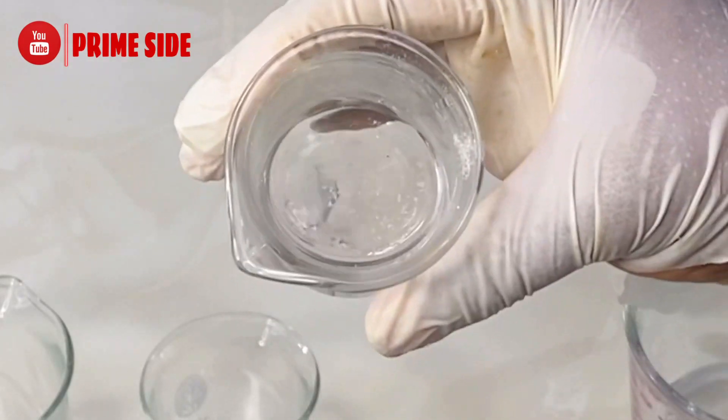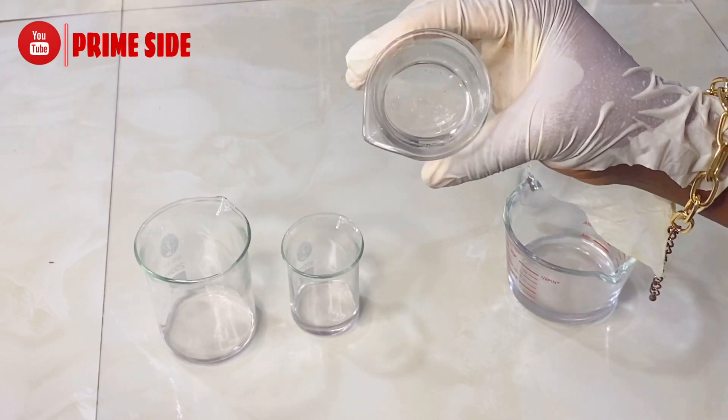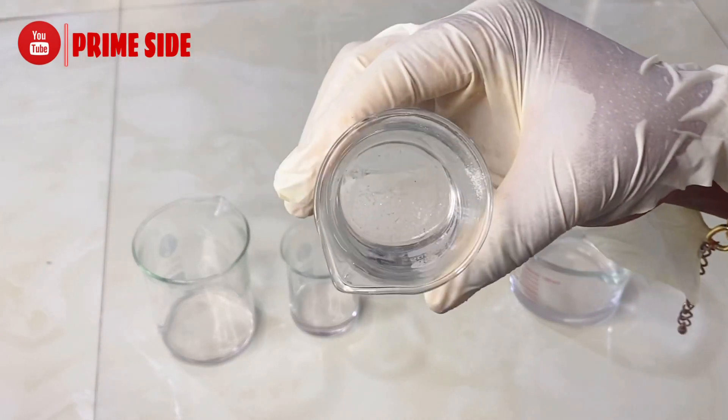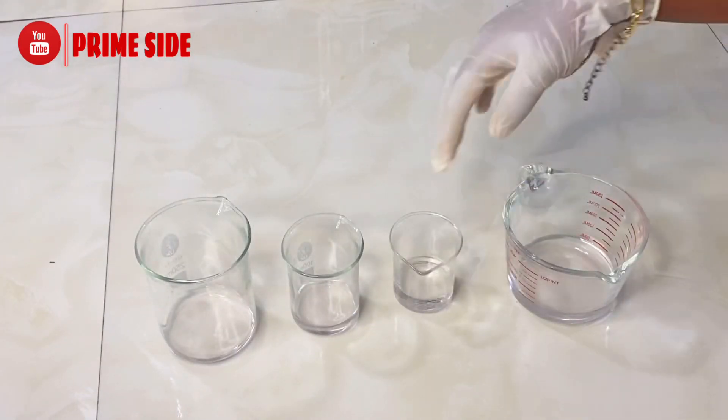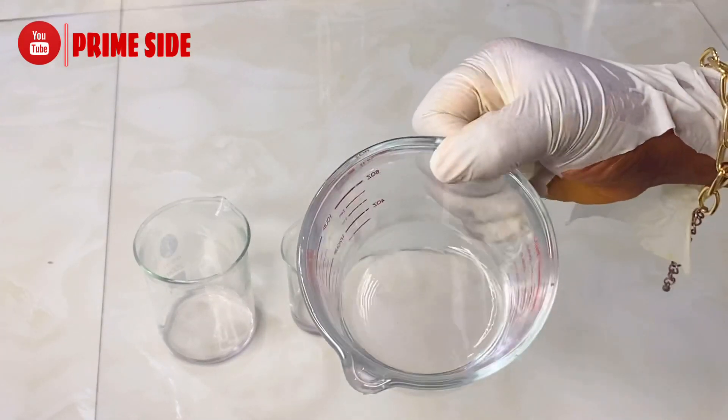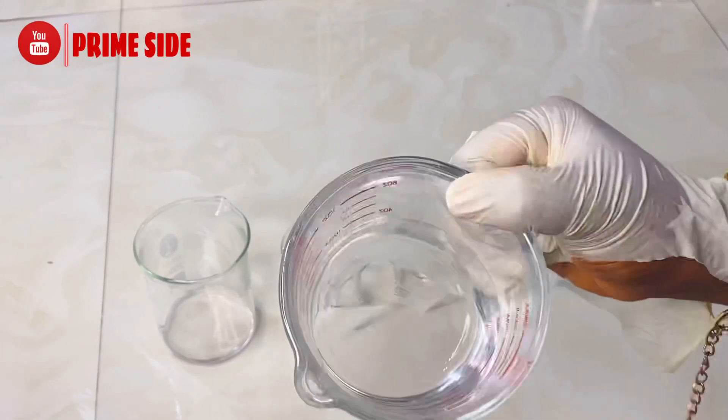I found out that some solvents didn't completely dissolve in my experiment, while some completely dissolved and saved time. So if salicylic acid is giving you a tough time dissolving, this video would be helpful.